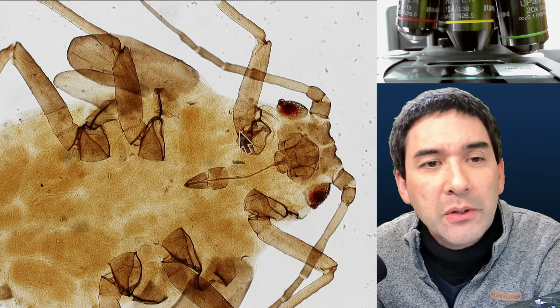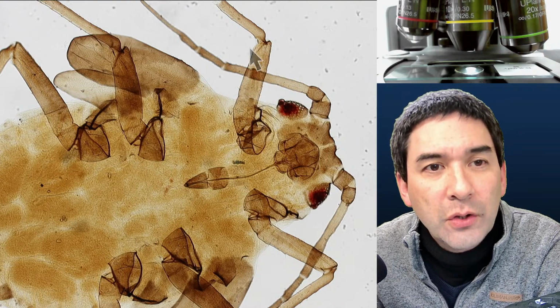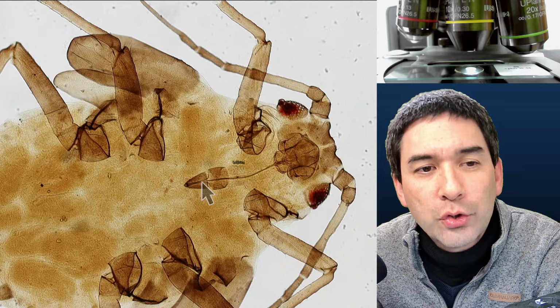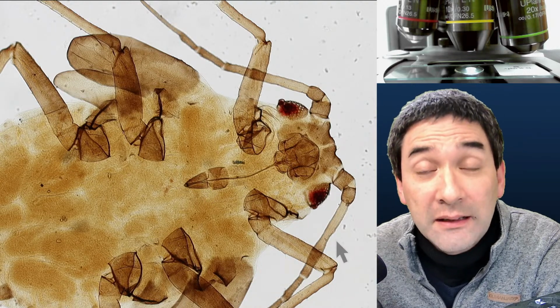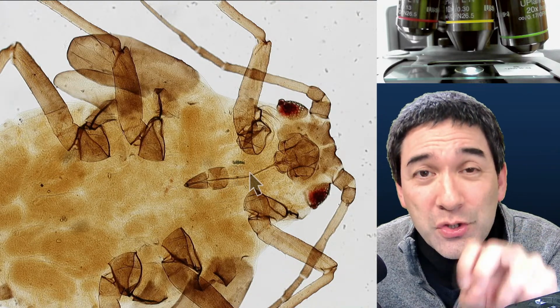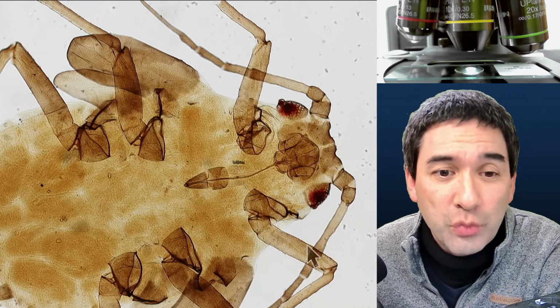Why do I know that? Because you basically count the number of legs. So we've got one leg pair, 2 and 3, so there are 6 legs present. And aphids, look, they have this long trunk over here. Aphids are those tiny little insects that sit on plant leaves, and they use the little trunk here to puncture the leaf and suck the sap of the leaf, and this can actually destroy the plant.